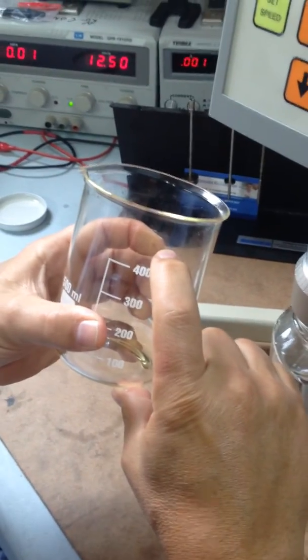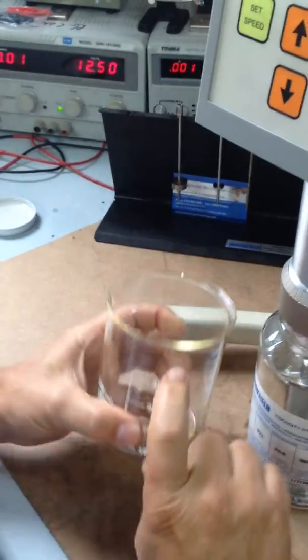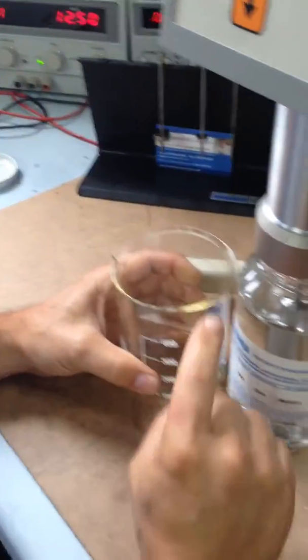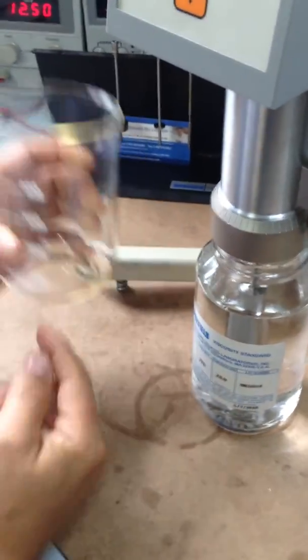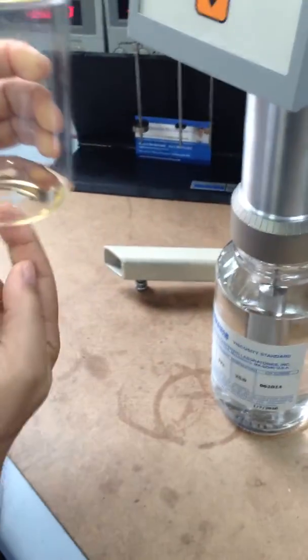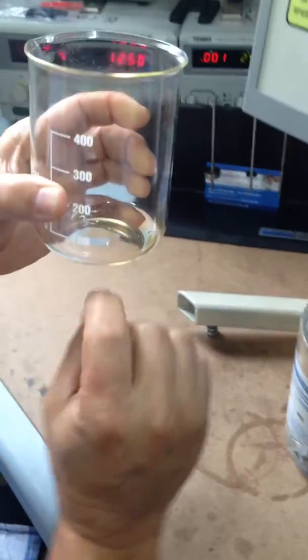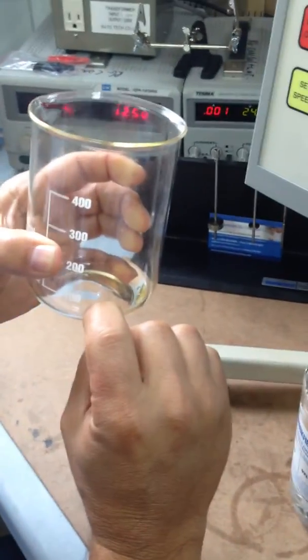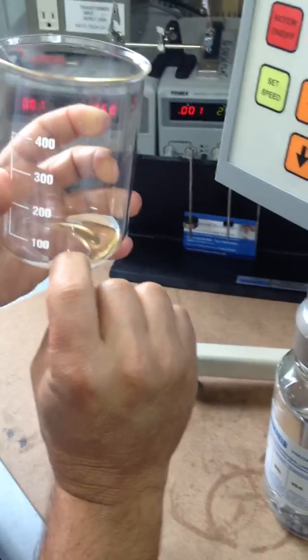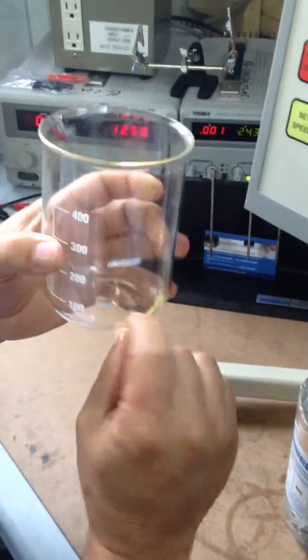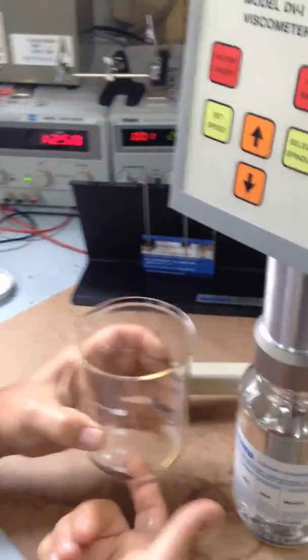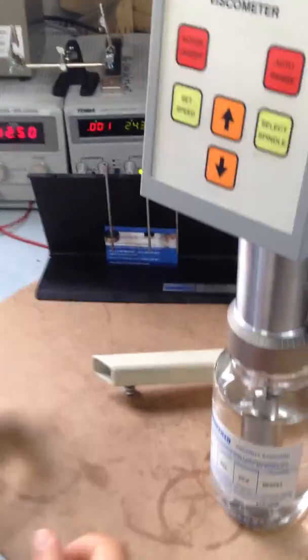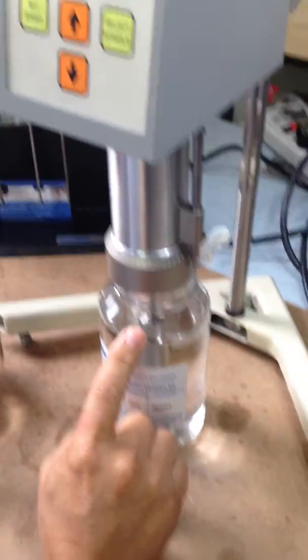You're going to fill it up and when you put it in you're going to see the mark up here. Make sure your spindle doesn't touch the bottom. You got to leave at least probably half an inch to the bottom, so the spindle doesn't touch the bottom. Right now we can do it directly in this viscosity fluid.